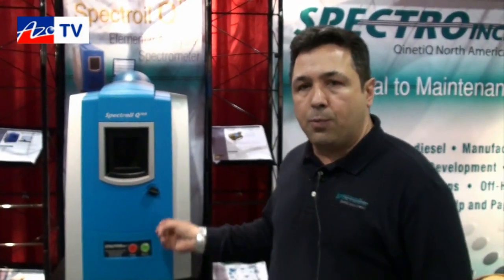The central LIMS software can be their own software because every file is exported in a CSV delimited format, or they can use our own LIMS system. We have an advanced web-based LIMS system called SpectroTrack. You can find additional information on our website. If anyone wants that information, they can go to SpectroInc.com — that's S-P-E-C-T-R-O-I-N-C dot com.